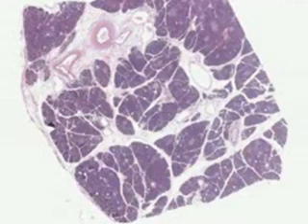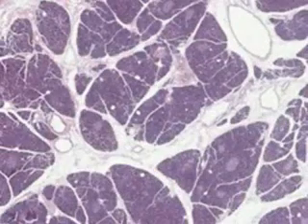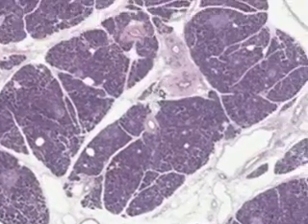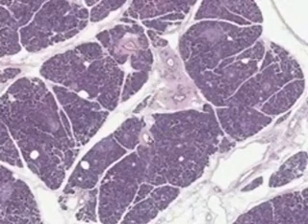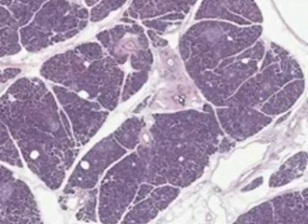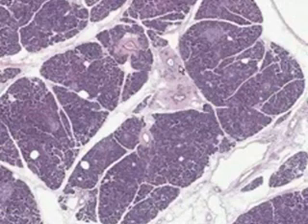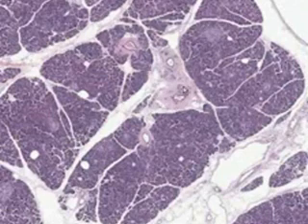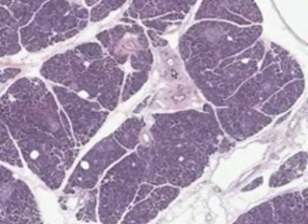Notice also that, like in any exocrine gland or the other salivary glands we saw, you can have ducts that are within the acini, like here, and ducts that are within the lobe, or ducts that are outside the lobe. So these would be called intralobular ducts, and there are several different kinds. And these can be called extralobular ducts or perhaps interlobular ducts. Doesn't matter what you call it.